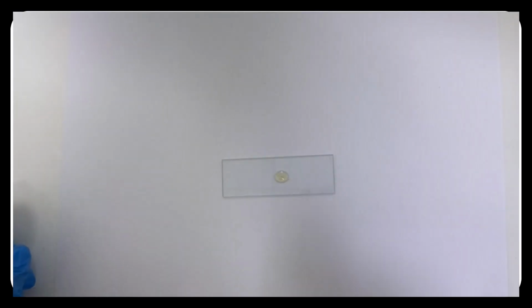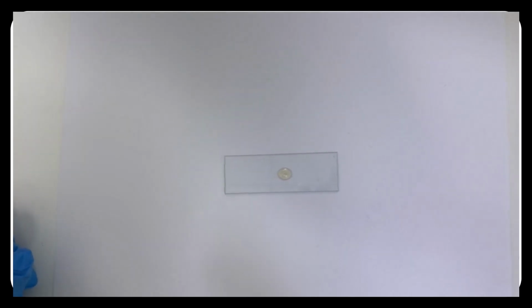Now, the procedure of the coagulase test. As I mentioned, the first step in identification of the bacteria is always a Gram stain, to see if the bacteria is Gram-positive or negative. If the bacteria is positive and cocci, we can differentiate between the two major Gram-positive cocci, Staph and Strep, by the catalase test, as all species of the staphylococci produce the catalase enzyme. Now, if the result of the catalase is positive, we can differentiate between the Staphylococcus species by the coagulase test.